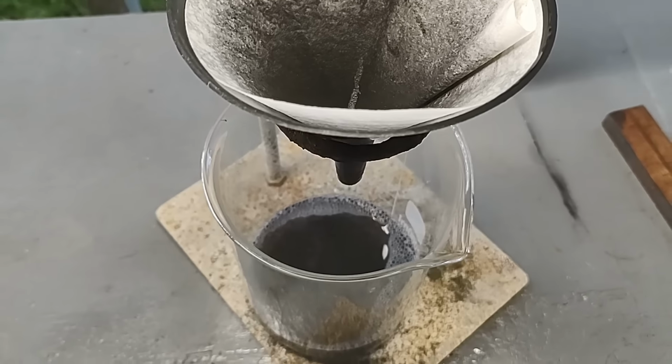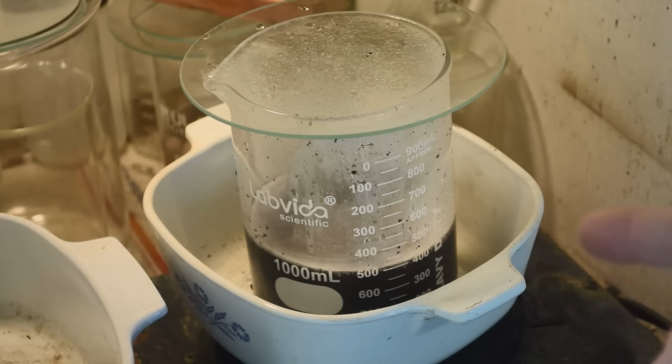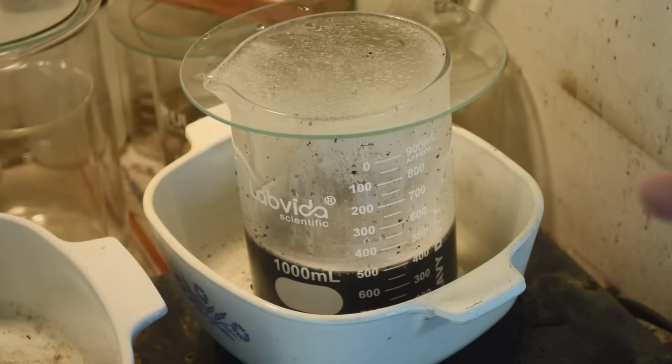Okay, let's wait for that stuff in the fume hood to come up to temperature and start boiling. So I'm trying to give this stuff a boil. And, you know, even though I have dumped off the bulk of the barren liquid, and I've even given this stuff a bit of a rinse and dumped off the barren liquid again.